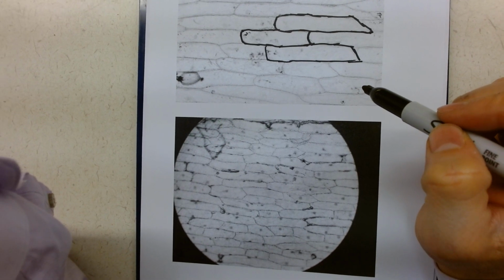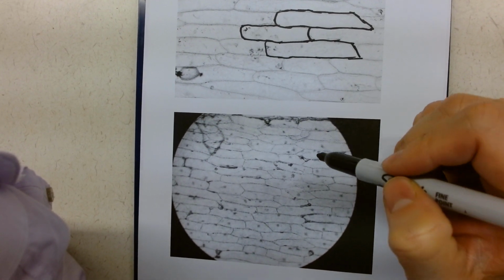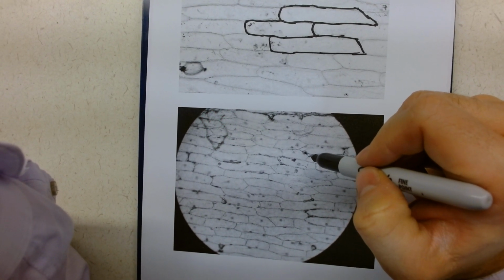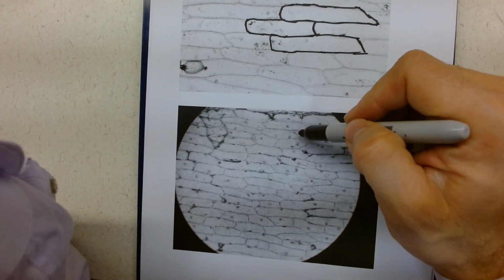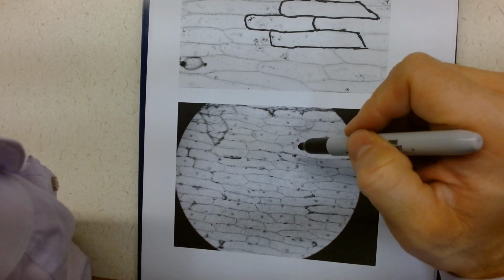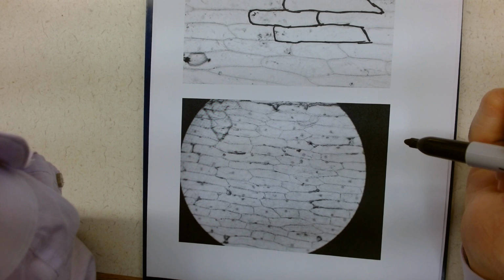What we did was we used iodine. By placing iodine onto the cell, the iodine was absorbed into the cell. The iodine was actually able to go through the cell wall and through the cell membrane, and we were able to see that certain organelles absorb the iodine in greater amounts.